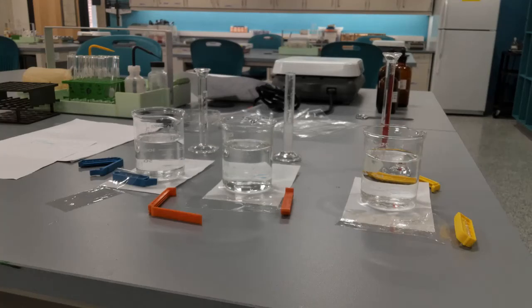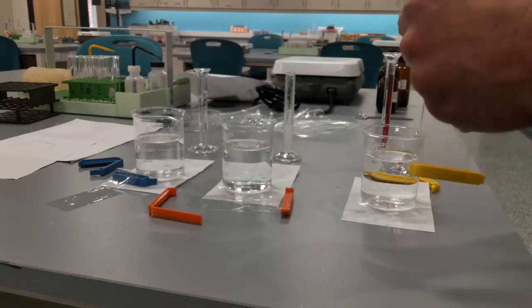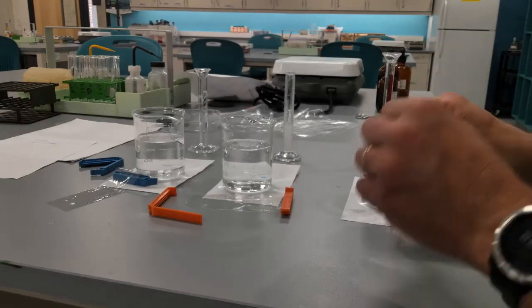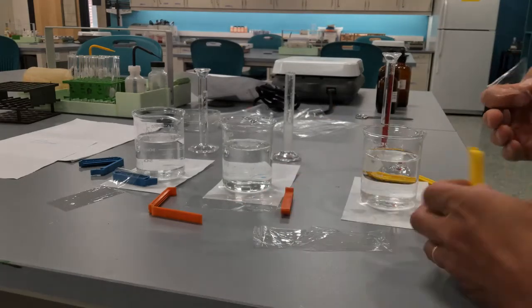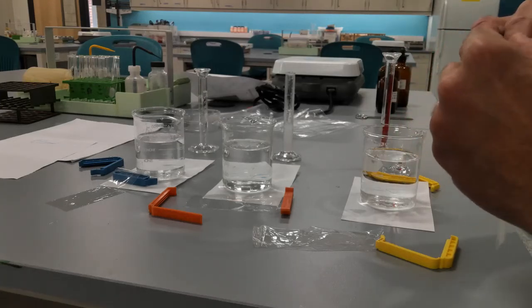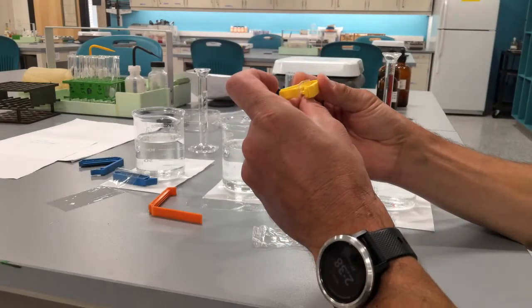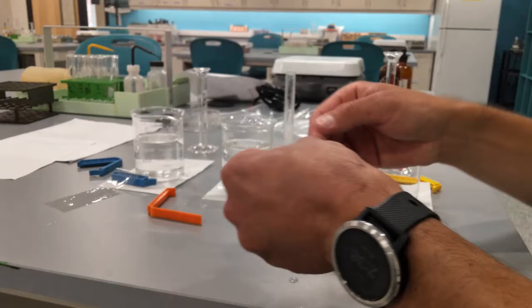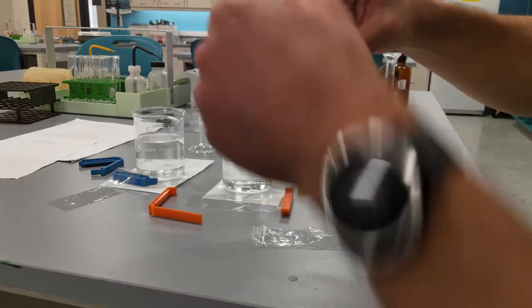So now we're going to try and fill the cellophane tubing. It seems like I have two pieces here. Okay. So this is how we folded and sealed the tubing. Look at this. I'm going to moisten the end of the tubing, and I'm going to rub the end between my fingers to open it up. So you see it's open now.